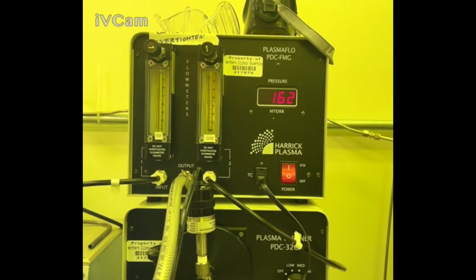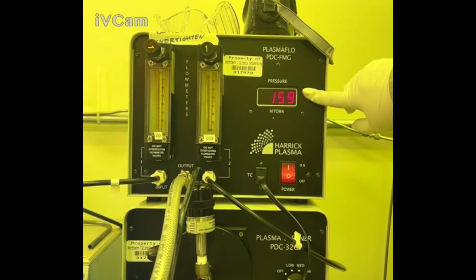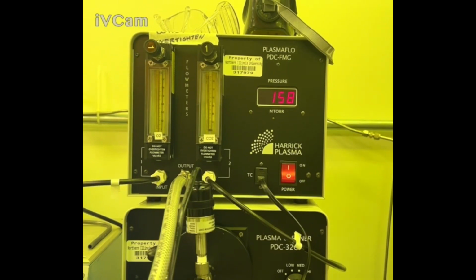mechanisms or some options to use if for whatever reason the oxygen is not connected properly, or if it is not giving you the oxygen amount that you expect it to do. By this time, you might see the pressure change a little bit or level out. Right now, it seems to be leveling at 160. It might continue to drop, but by the time you open up and let in the oxygen, you're going to see the pressure change a little bit as a reflection of this.